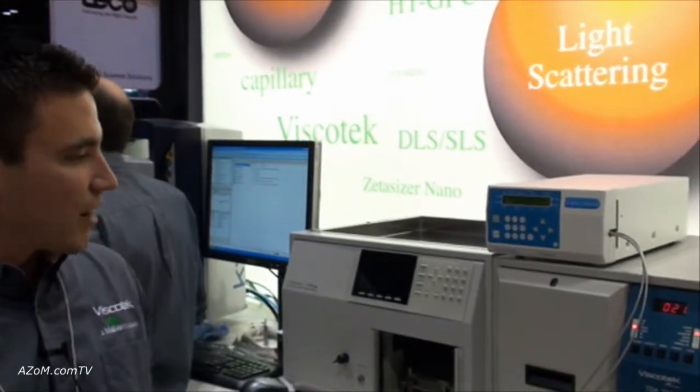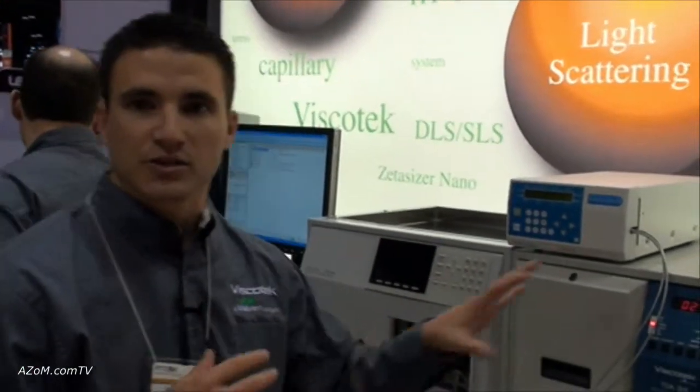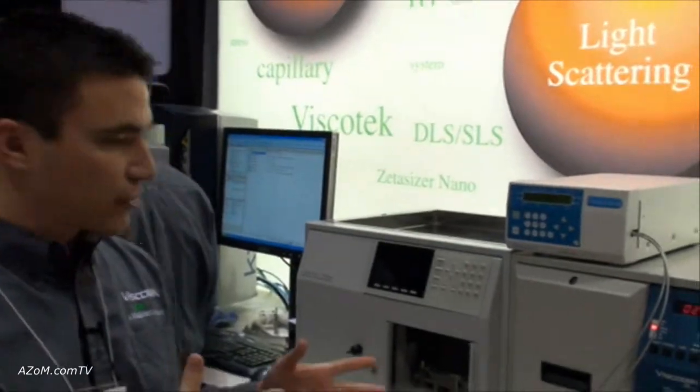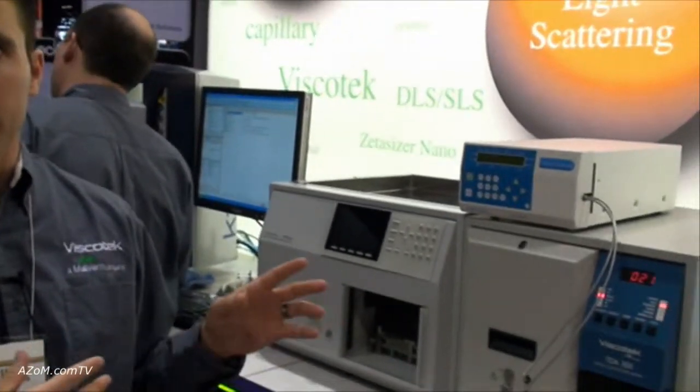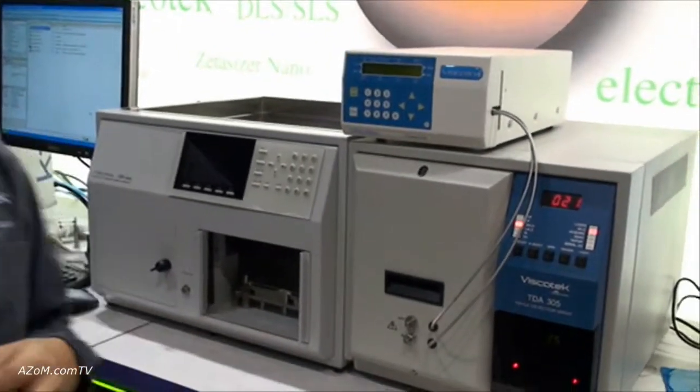They offer a complete system package with software, front-end pumps, degassers, detector technology, and temperature control. We'll take you through the system and then cover some of the new detectors that are available.